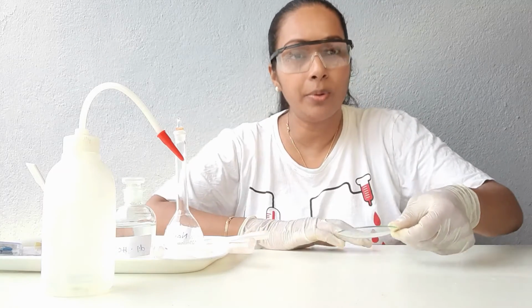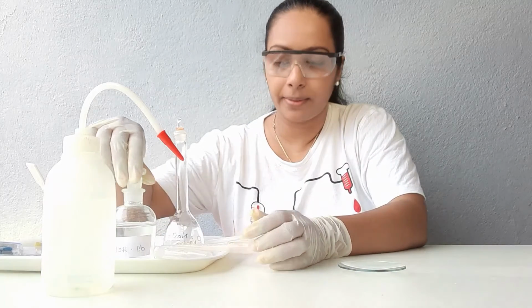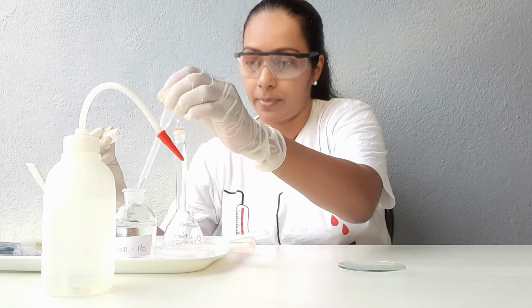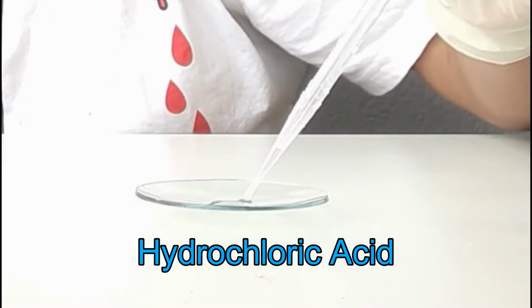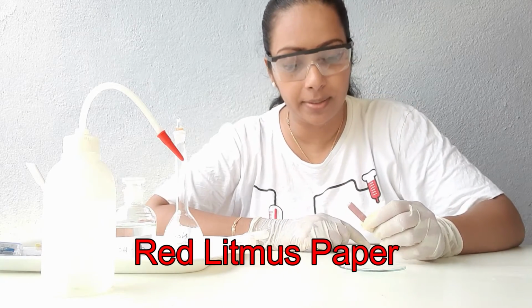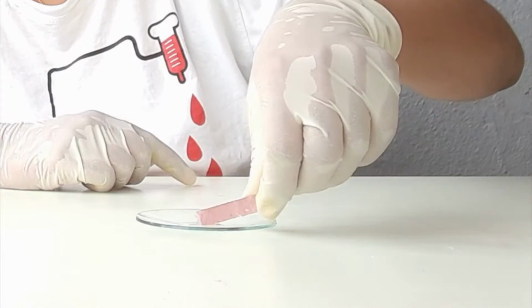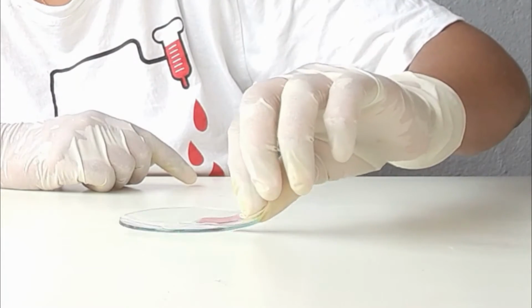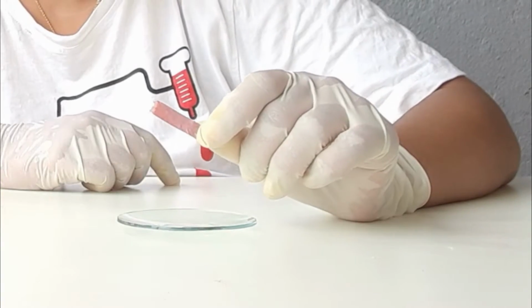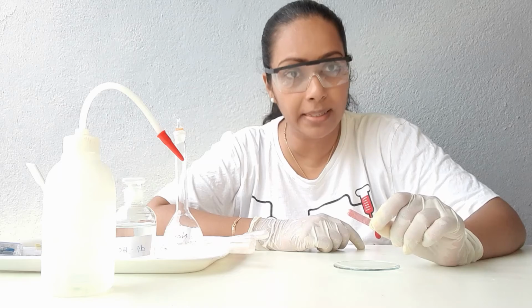Now, I'm going to try a sample of acid. Let's try out a piece of red litmus. Did the red color change in the litmus paper with the acids?